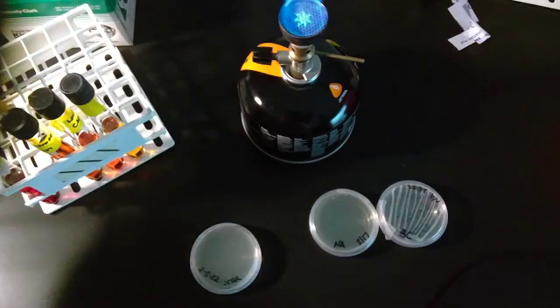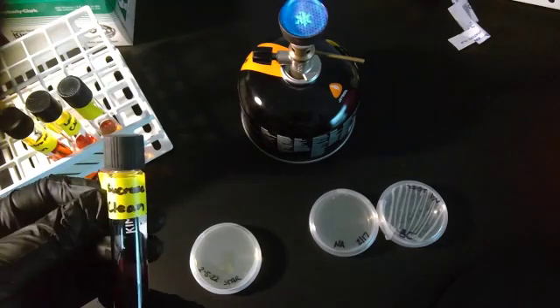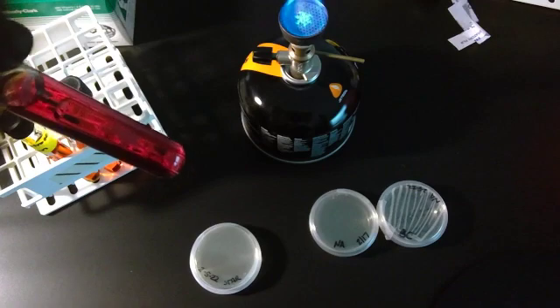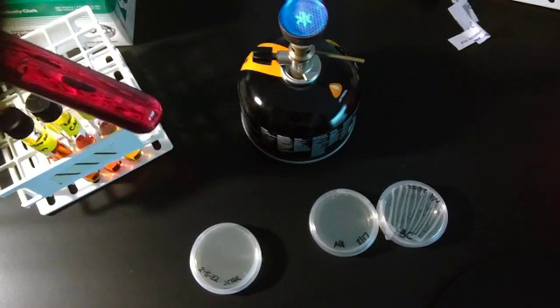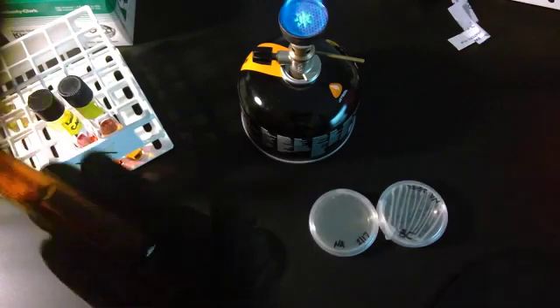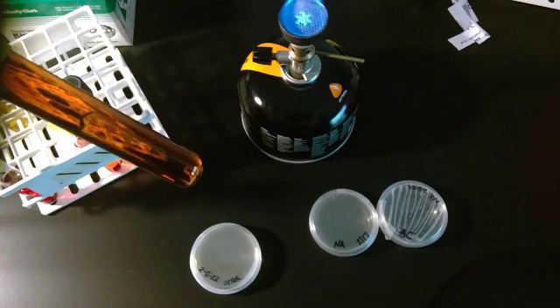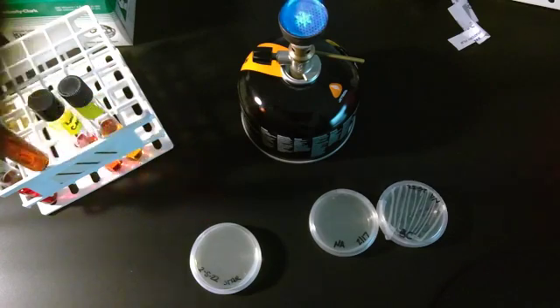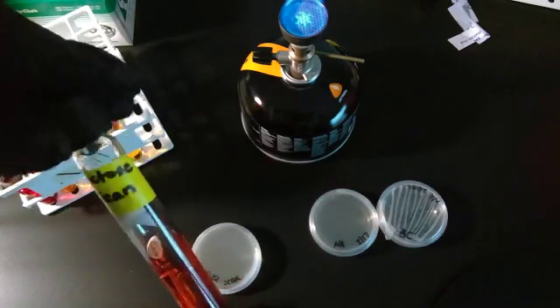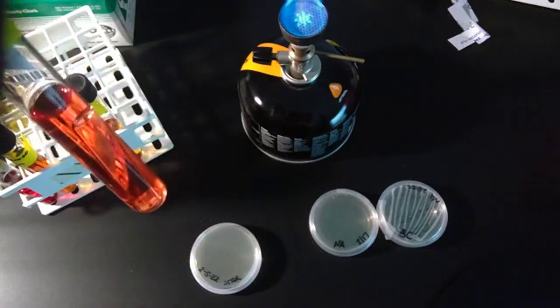We also have our phenol red tubes with different types of sugar. So here's the sucrose tube. It is red, and I've got that Durham tube, the upside down baby test tube in here that I talked about. I have the dextrose tube, and again you can see and hear that that little tube is in there. I've got the lactose tube, and you can see the little tube there.